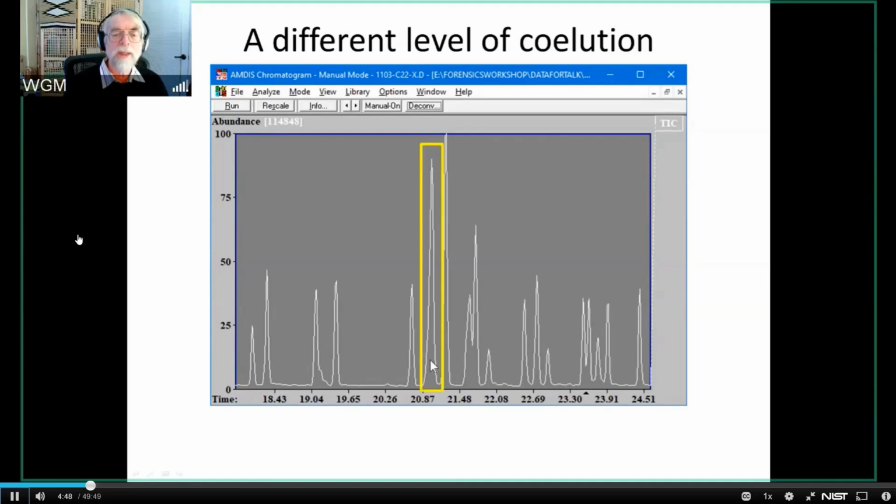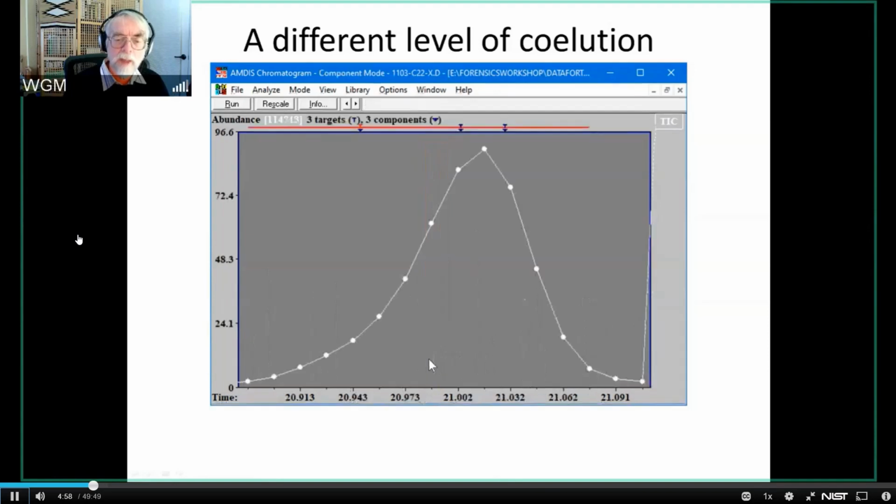So we're going to examine this peak, and I'm doing all of this within AMDIS, and so this is just a take it to the screen and blow it up. And when I do it, I get this. And once again, it looks like at first glance that I've got a fairly clean TIC. And it's at the point that you go beyond the TIC and look at the individual ion chromatograms that you begin to see that there's something quite different going on there.